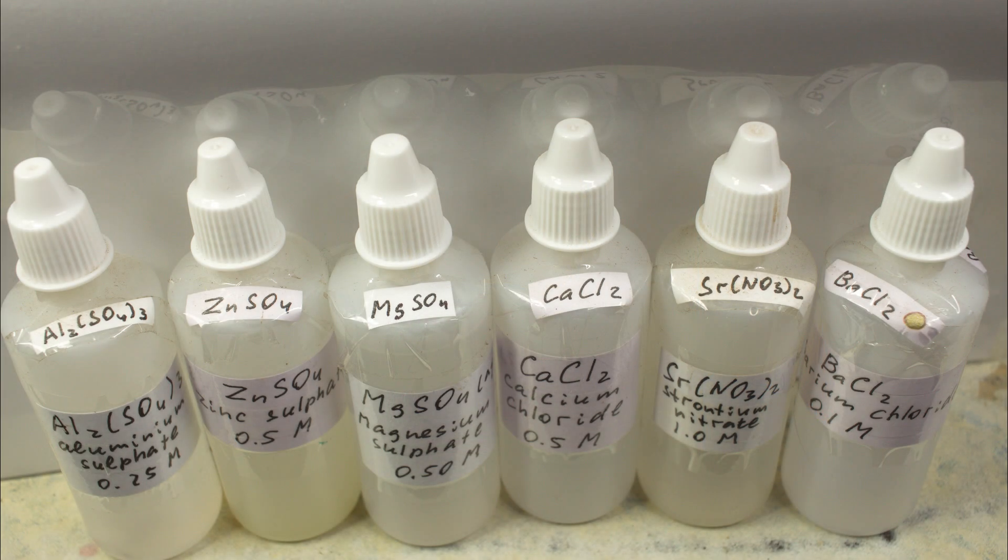Let's study the salts. Aluminum, zinc, magnesium, calcium, strontium, barium chlorides, sulfates, nitrates. These are salts, white, crystalline and they form colorless solutions.